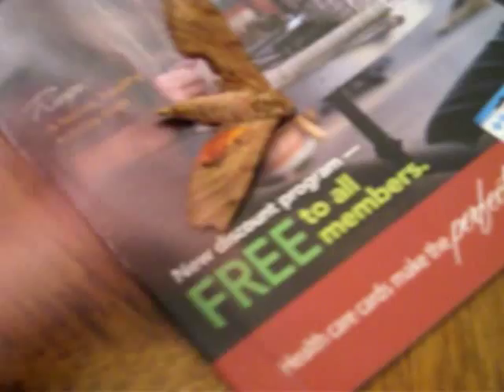We've been turning up a lot of these dead in the parking lot at work lately. Must be their season to either hatch out or mate or something. They're big fellas — there's my fingers for comparison. When I found one laying dead on the asphalt, I decided it would be a really good sample for microscope work.